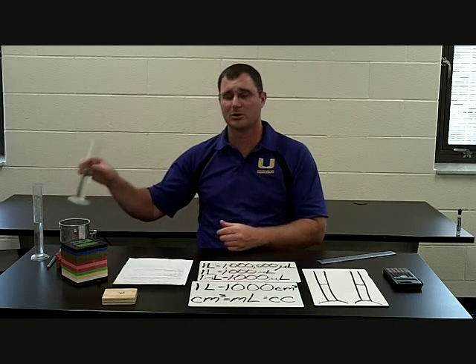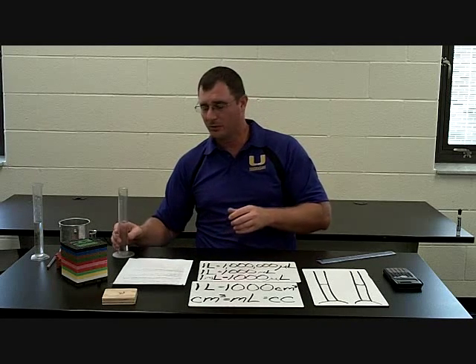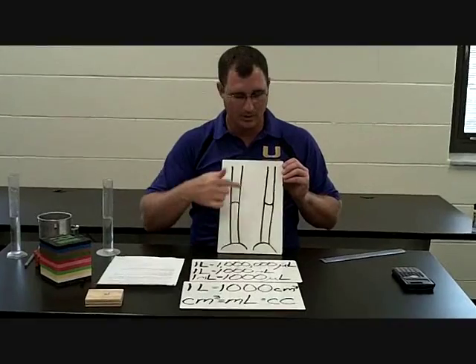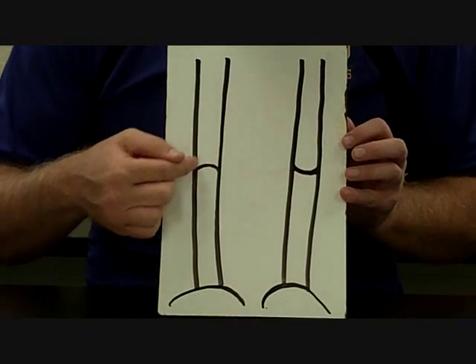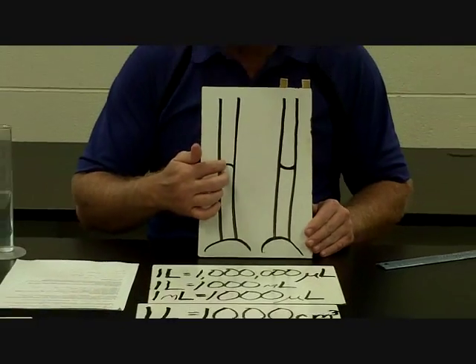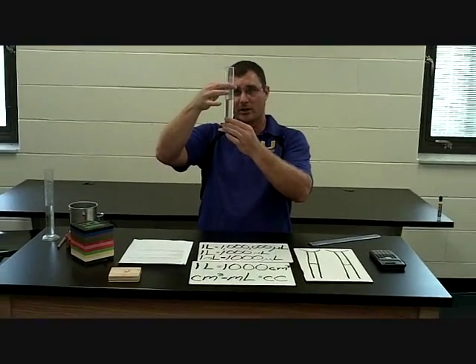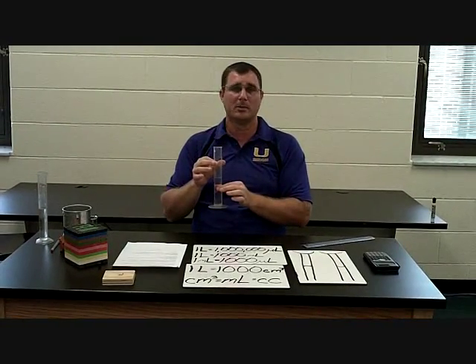The way we measure liquids is very easy — we're just going to put them in a graduated cylinder and measure them. Now when you measure in a graduated cylinder, you want to look at the fluid level, but there's usually what's called a meniscus — there's a curve. That curve can either be up or down depending on some of the properties of the liquid you're using. If the curve is up, you want to measure to the top of it, the center. If the curve is down, you want to measure to the bottom of it, again the center. I always just remember to measure to the center of my liquid. You want to make sure your eye is down at the water level and you're looking straight across. These that we're using are in milliliters, and you want to make sure you're estimating one spot, just like we always do.